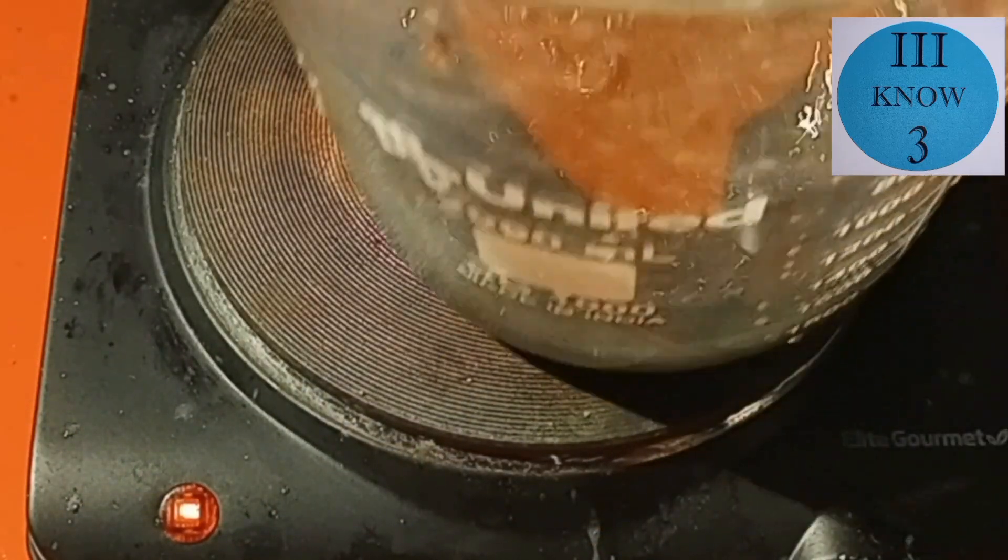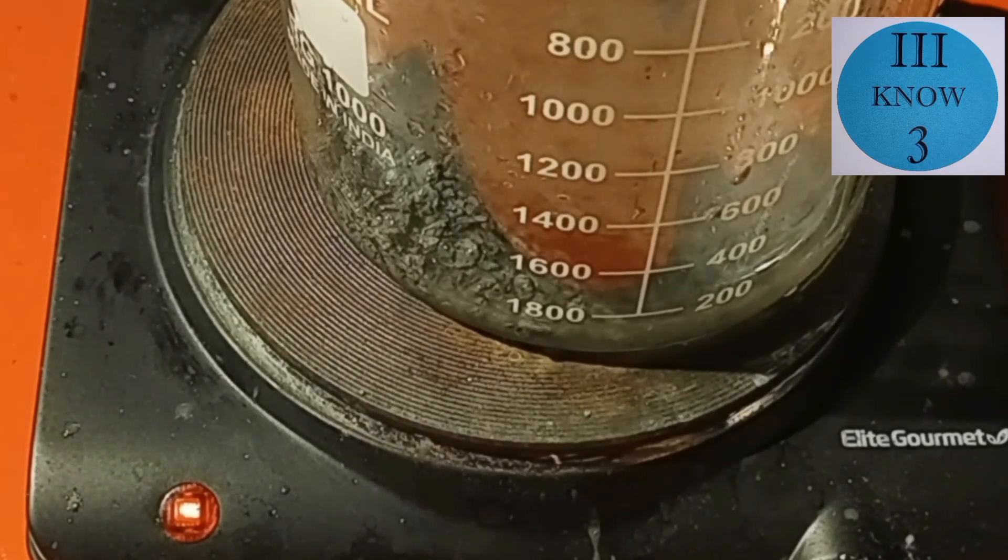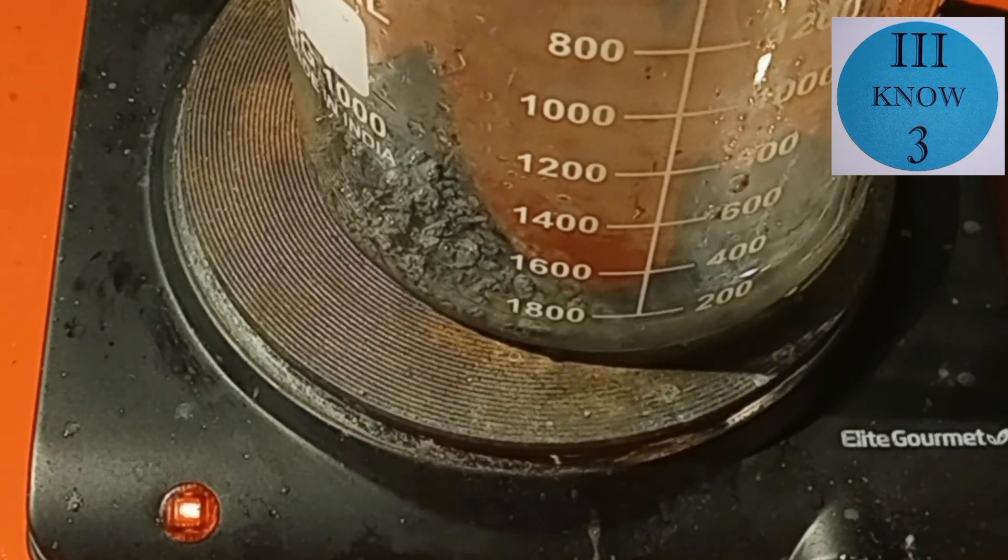And you can start to see a little bit of a reaction here. There's some tiny bubbles, but because of these colors, it's not showing up that well on video.